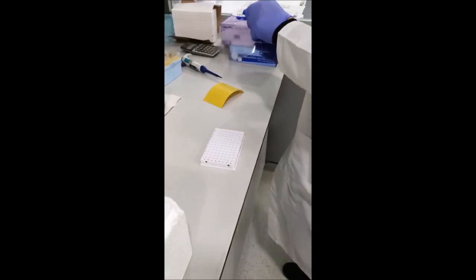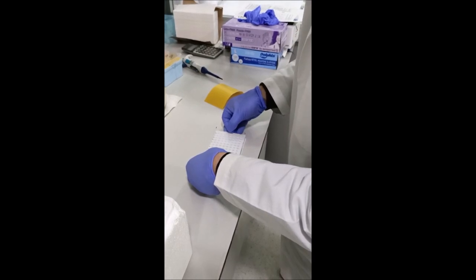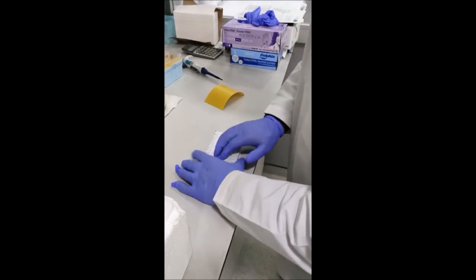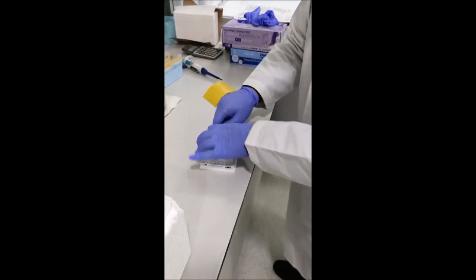Now we are sealing the plate and our reactions are ready to go into the PCR instrument.